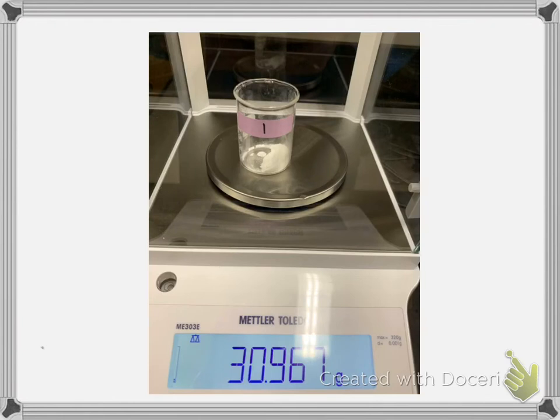And so then it tells me in the procedure to put it in a beaker, which you can see there's labeled. I put it from the all ground up into this beaker, and this number is a 7. It's hard to see with the glare. And this right here is the mass you're going to record, and it's the mass of the beaker plus the antacid sample.